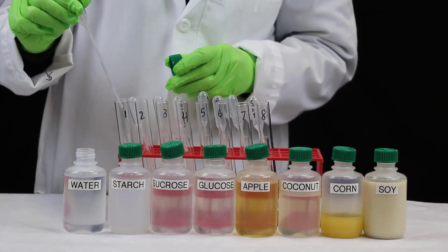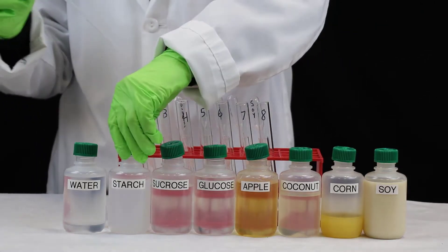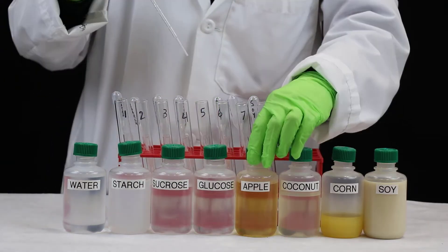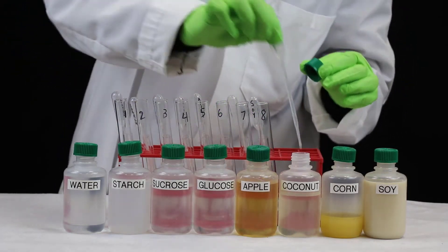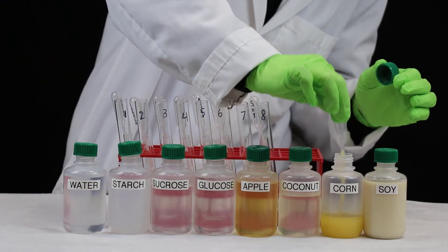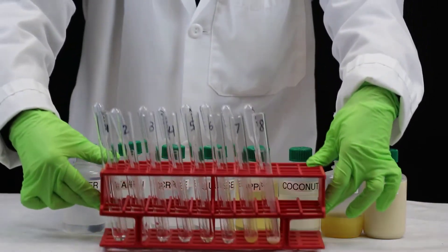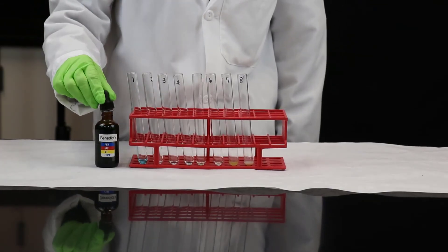Add about half a dropper of each solution to the appropriate test tube. Now add 10 drops of Benedict's solution to each test tube.